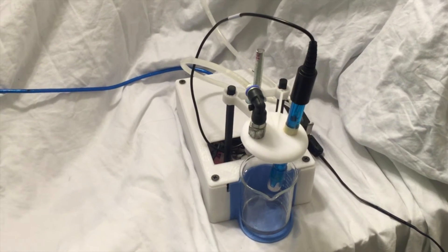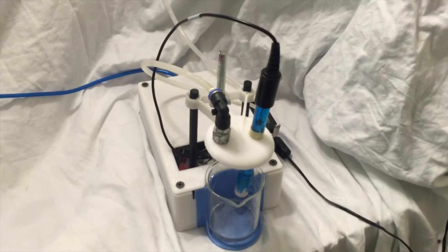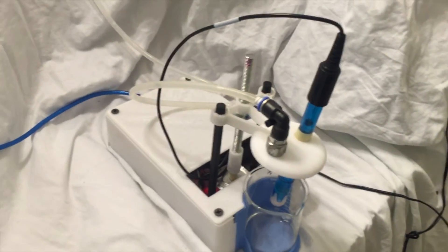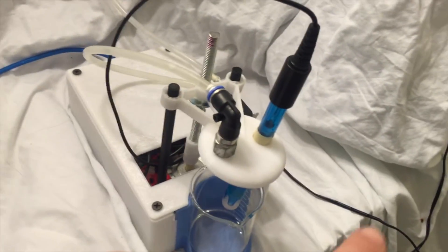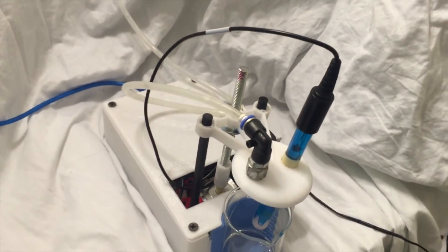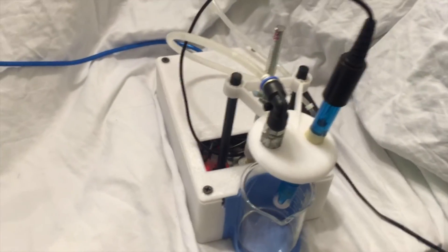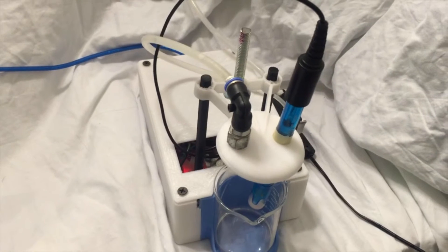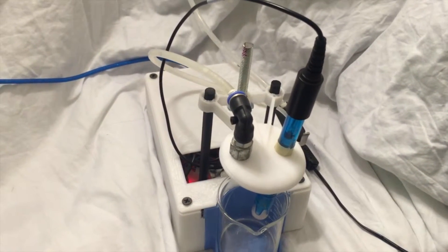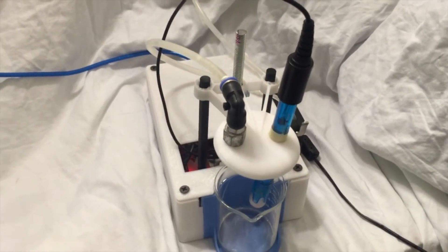Here's the current version of the automated titration machine I'm working on. Once I turn this machine on, it's going to bring this array mast down and then begin cycling the peristaltic pump. Once it's finished, it's going to go back up and hold that position.